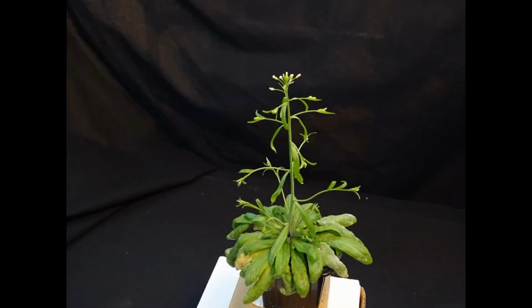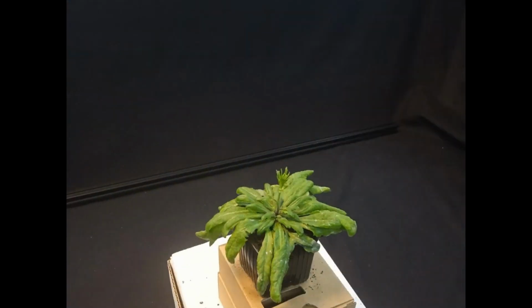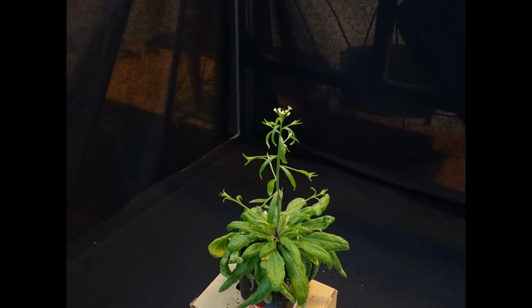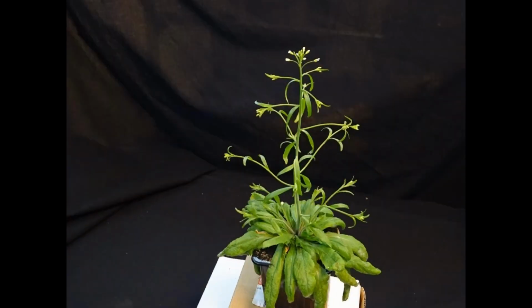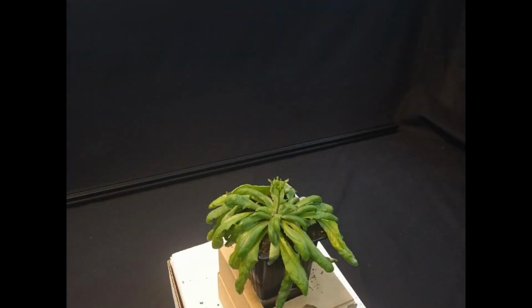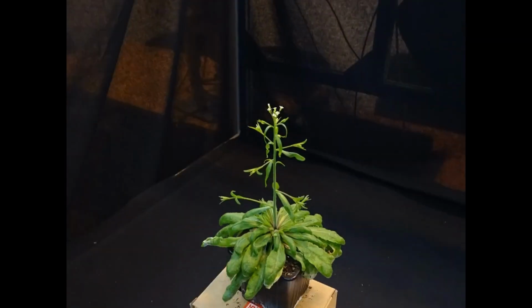We could follow growth of the plant from bolting, the stage at which the main stem grows out of the flat above-ground rosette, up to the appearance of the first flowers and fruits. Despite the lack of automation to acquire time points, this demonstrates the ability of our plant imager to generate quality datasets of plant growth in 3D.